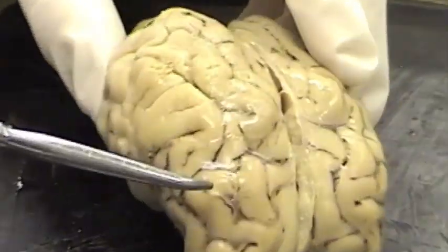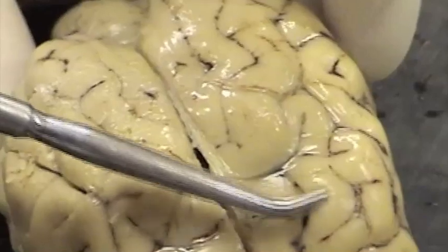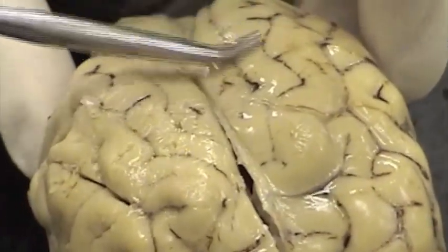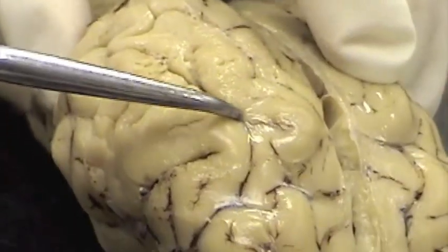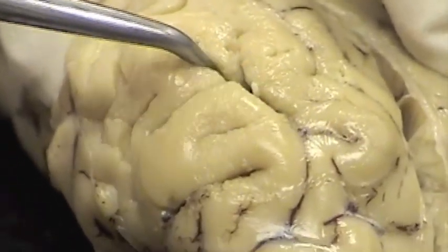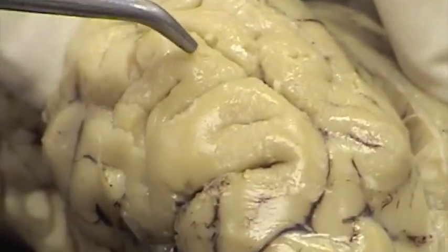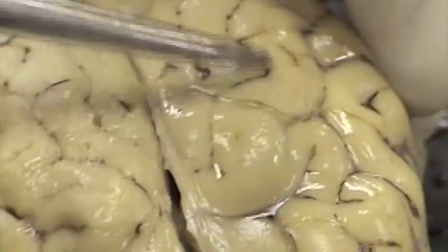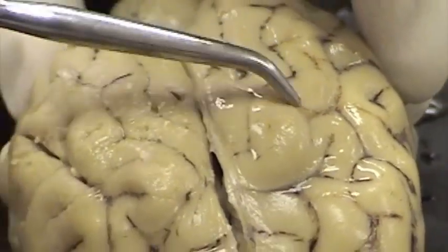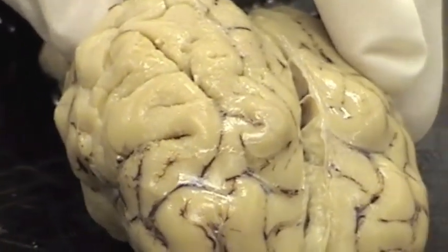On this side of the brain, in this hemisphere, we can see that the arachnoid has been removed. On this side we can see a filmy saran wrap layer — the arachnoid — and on this side you can tell that it's been removed, first by the fact that I can easily put the probe into the sulci without breaking through any membrane. Therefore these gyri are covered by pia mater, which hugs the brain and extends on the gyrus down into the sulcus. So we have the arachnoid over here where you cannot get into the grooves, and over here you have the pia covering all these bumps of tissue known as gyri.